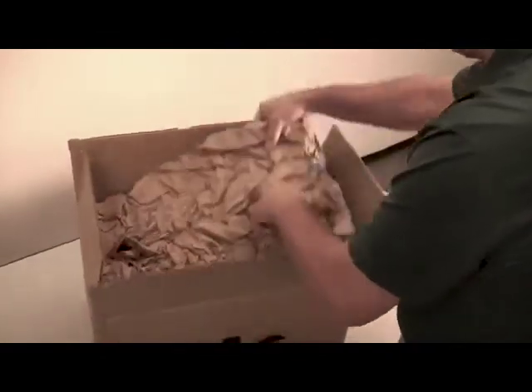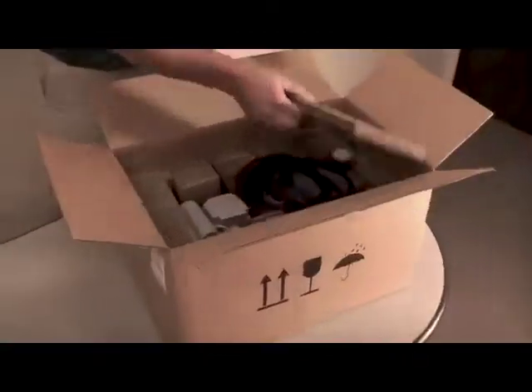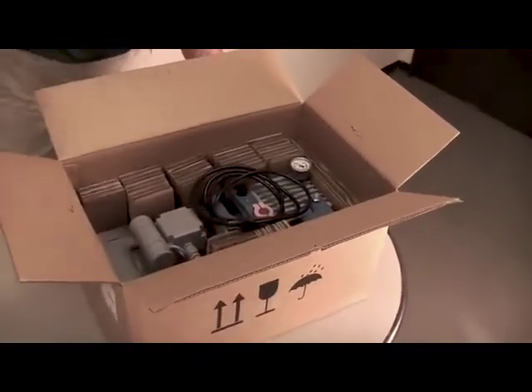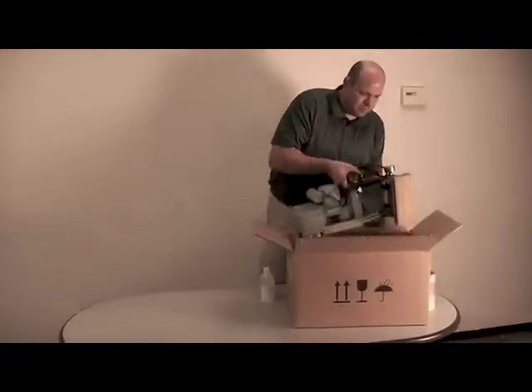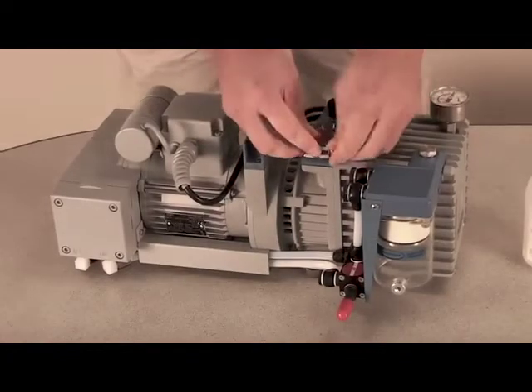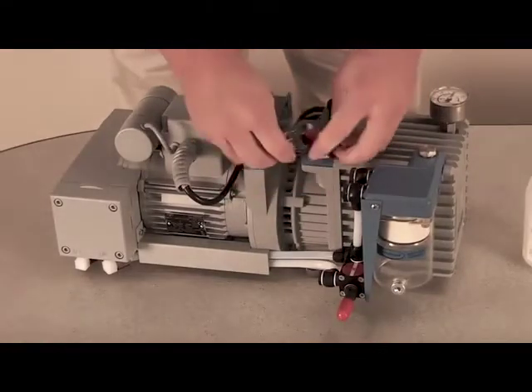To begin, remove the pump from its shipping carton. Remove the protective covers from the inlet and outlet ports.